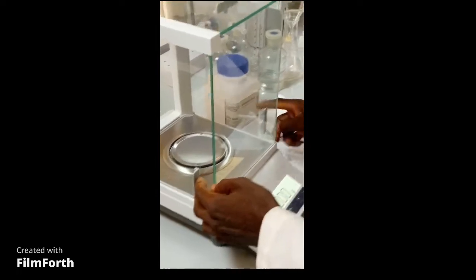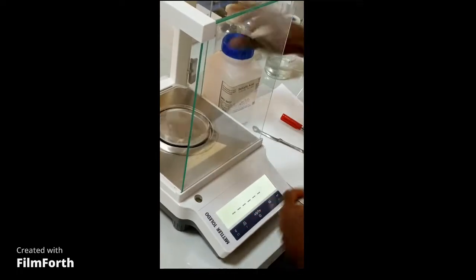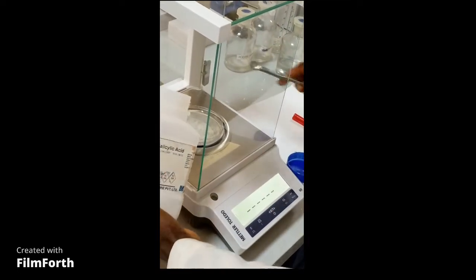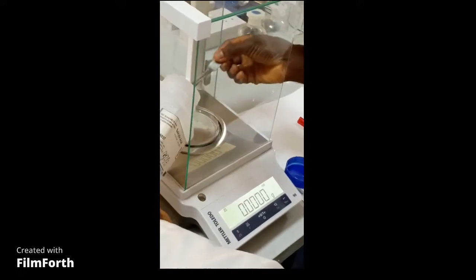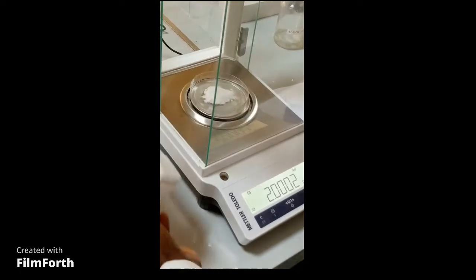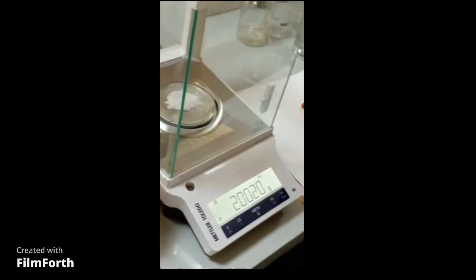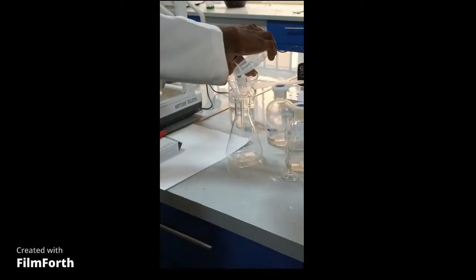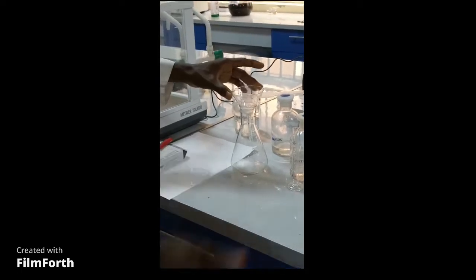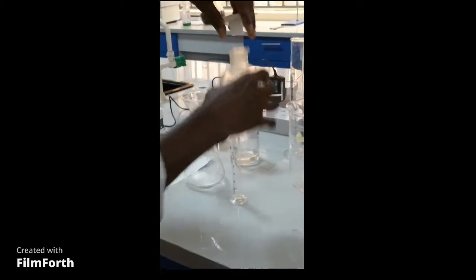Weigh 2 grams of salicylic acid. Take note of the weight of the sample. Add this into a clean, dry conical flask. Add 4 ml of acetic anhydride.